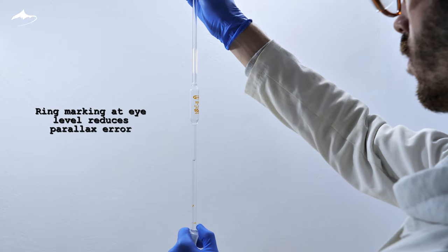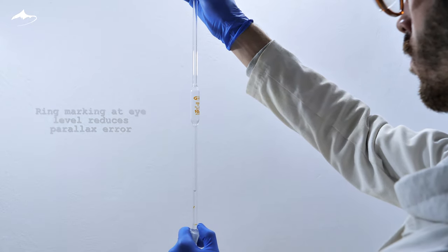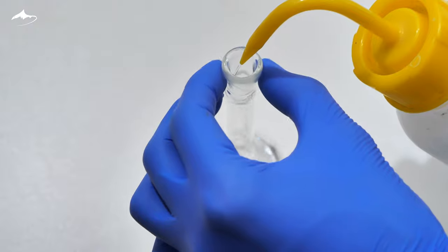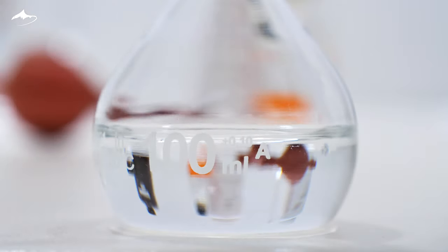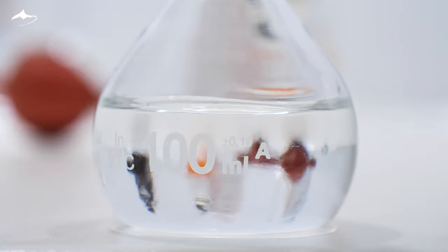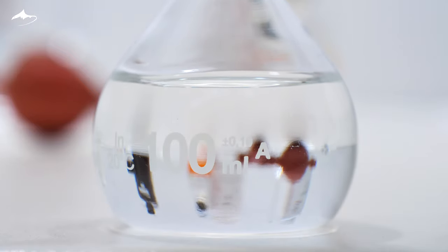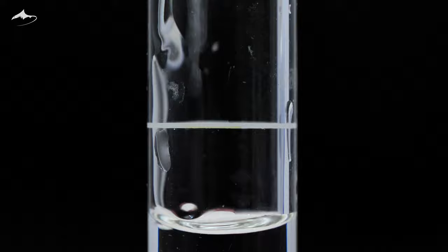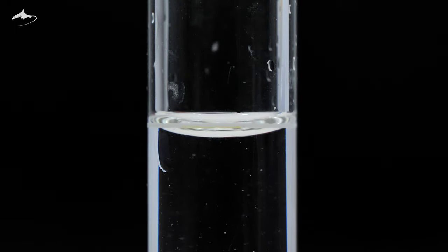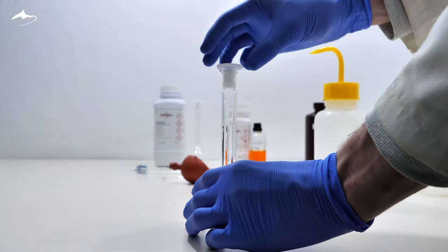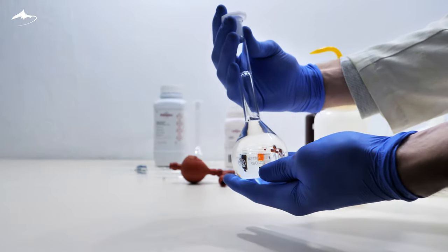With this, the concentration of the seawater is a tenth of that of the original sample, which needs to be considered in the calculations. Once again, the flask is topped and mixed a couple of times.